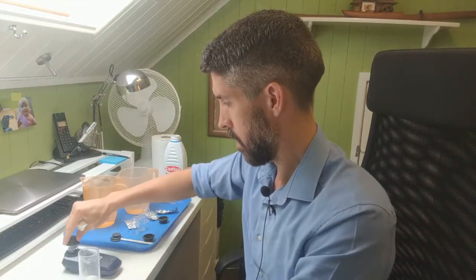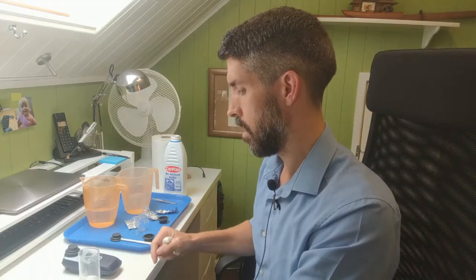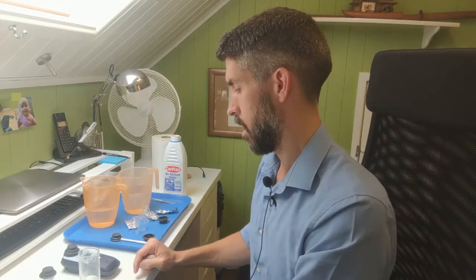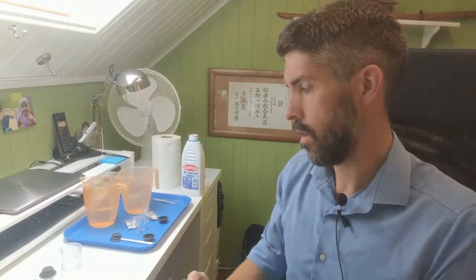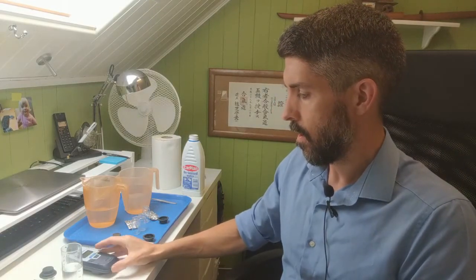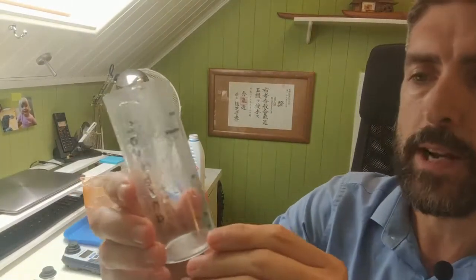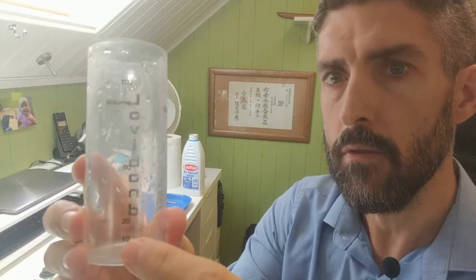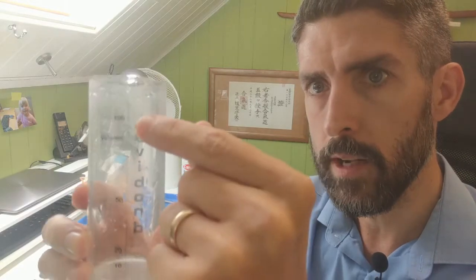So let's get a blank, get it on 0, and then put the sample in and get a reading. And what we've got here is, I hope you can see that, 4.02. Now if I show you just the side of this. Now we had it with 10 ml of the original pool water sample, the chlorinated water sample. We only used 10 ml. The rest of it we used distilled water.